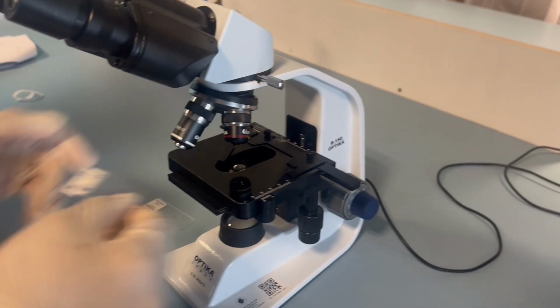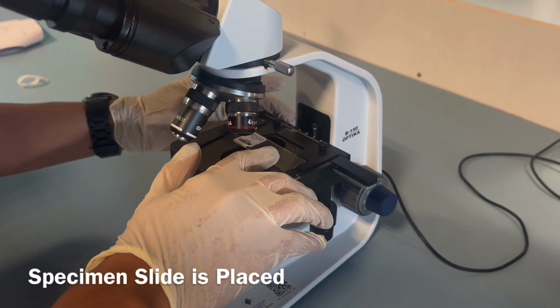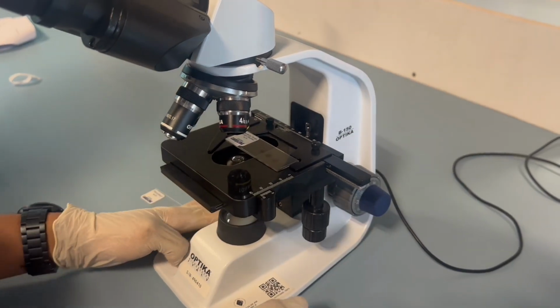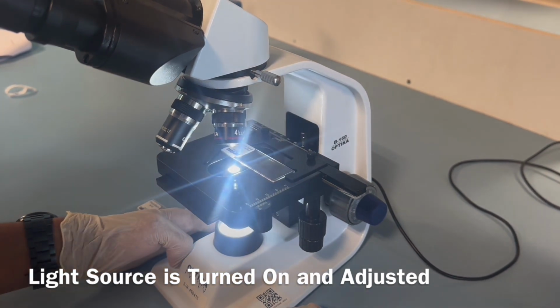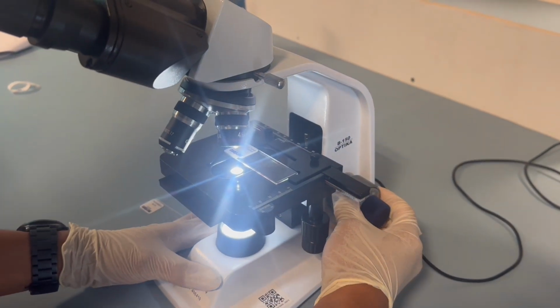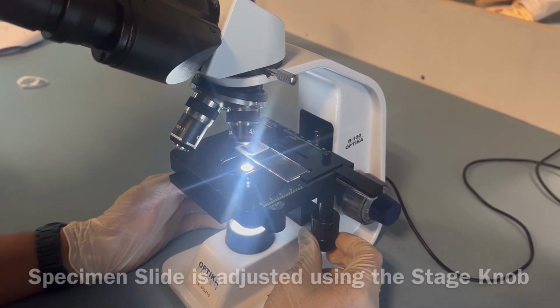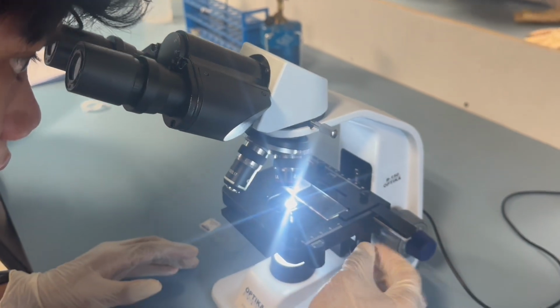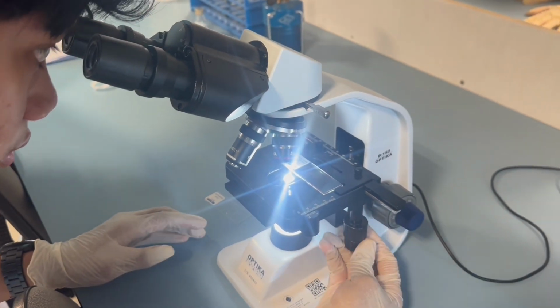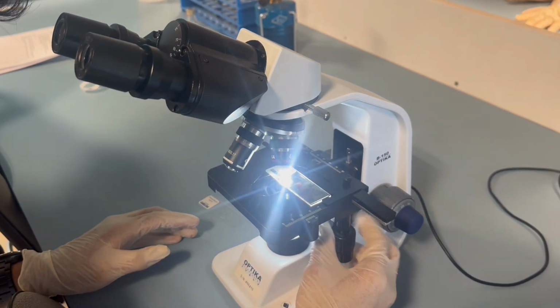So first thing first, the dust cover was removed and the microscope is switched on, and then the specimen slide is placed to view the specimen through the microscope, and then the light source is turned on and adjusted. The specimen slide is adjusted using the stage knob, x-axis and y-axis, so that we can view the specimen through the microscope.